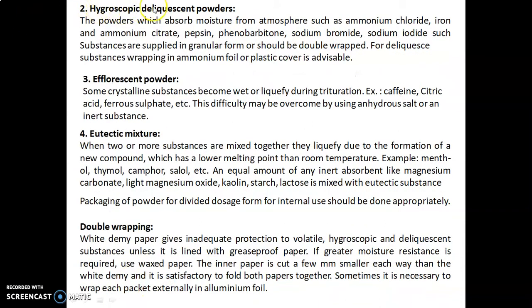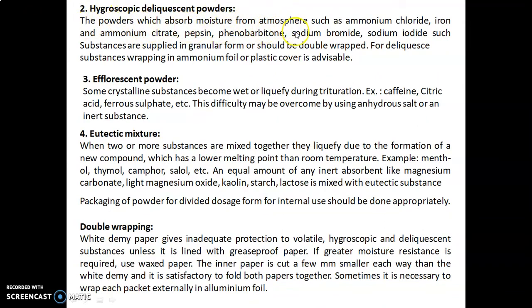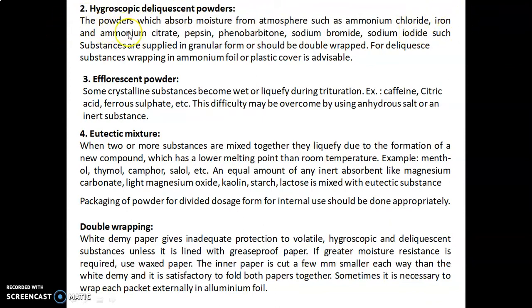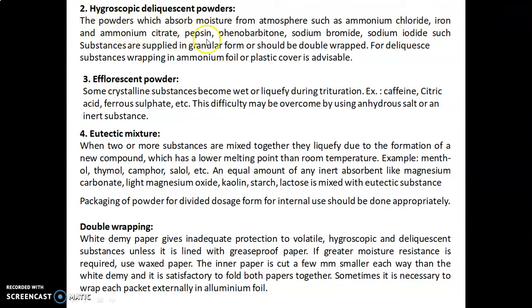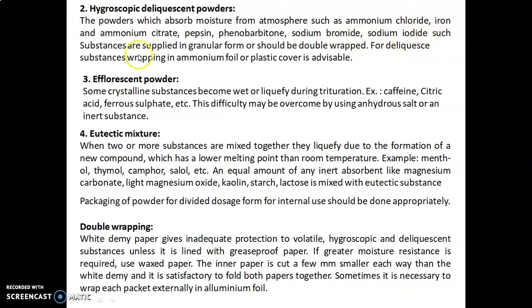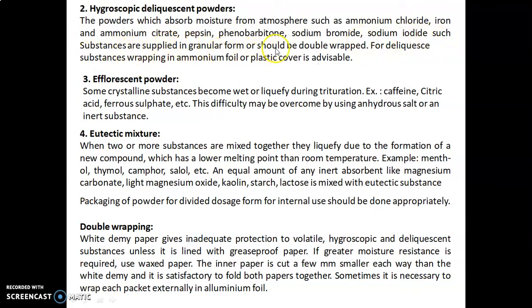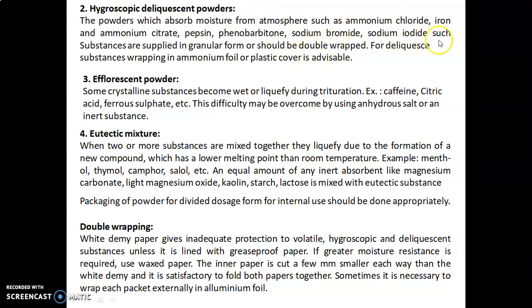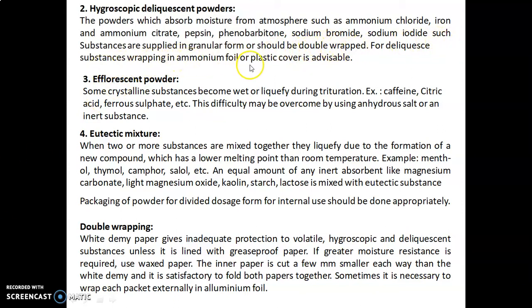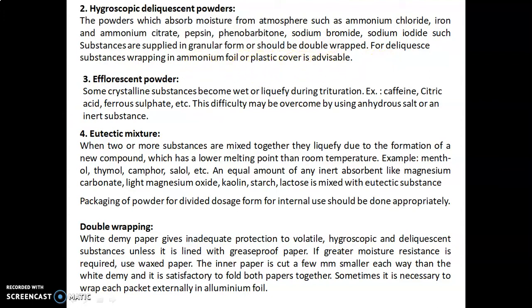Second, for hygroscopic and deliquescent powders: powders which absorb moisture from the atmosphere — such as ammonium chloride, iron and ammonium citrate, pepsin, phenobarbitone, sodium bromide, and sodium iodide — should be supplied in granular form or double-wrapped. For deliquescent substances, wrapping in aluminum foil or plastic cover is advisable.